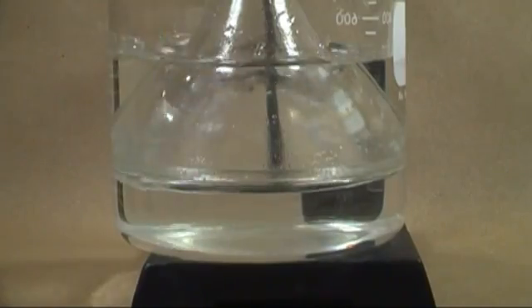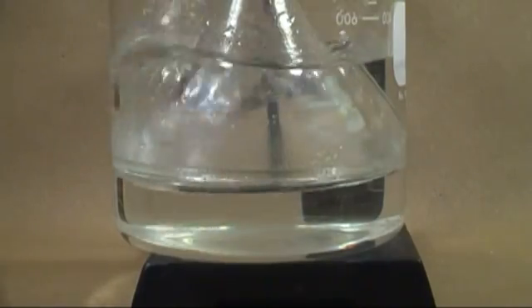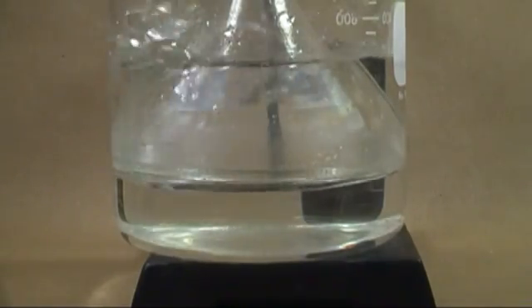As the pressure continues to increase, the gas will begin to bubble out in the beaker and into the water that was displaced in the funnel. This will continue as long as the pressure is increasing.